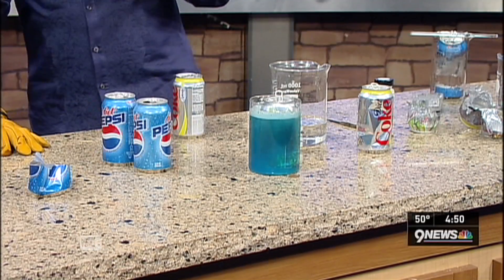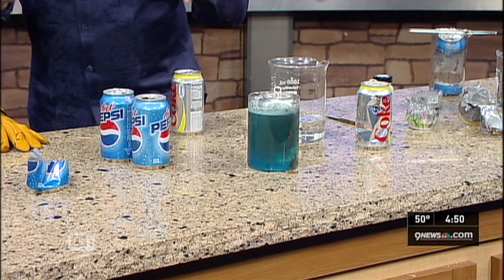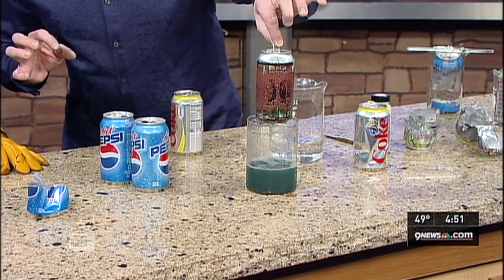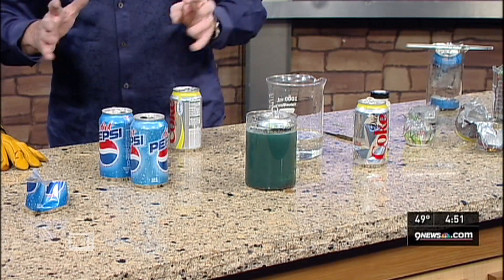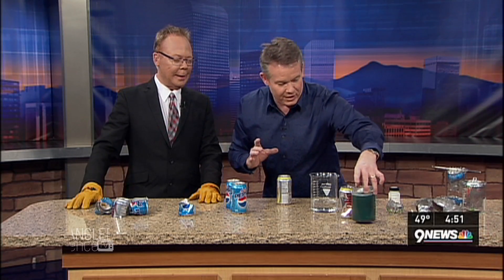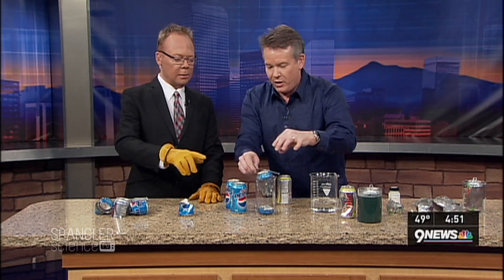Oh, this is good. Is this safe? It's immediately eating away at the aluminum. It eats away at the aluminum, and when I pull it out, look at this — you can see immediately how it starts to eat it. Is that the coolest thing? It's smoking and everything. Are we in danger? Well, kind of, but it's fine. We have insurance. So it's going to sit there and eat away. And if I let it sit there for a little while — would you look at this? This one was eating away not that long ago.